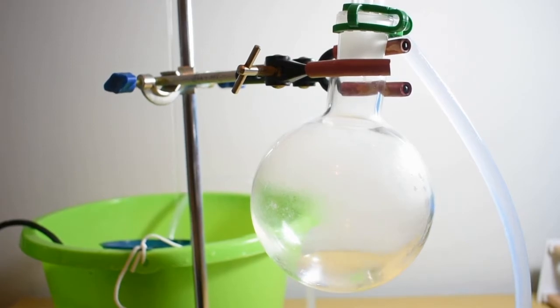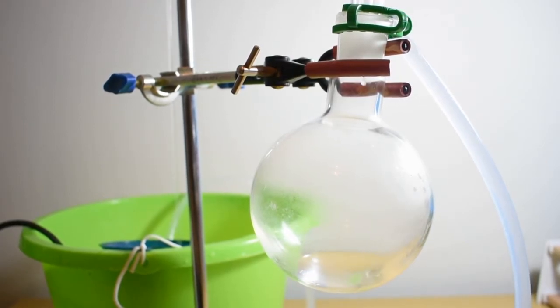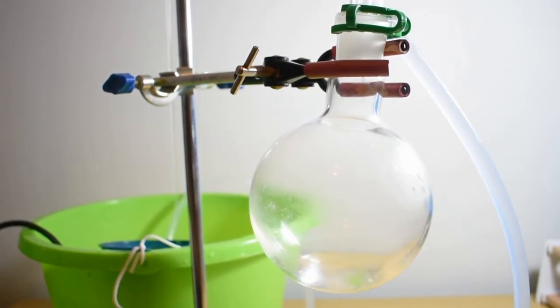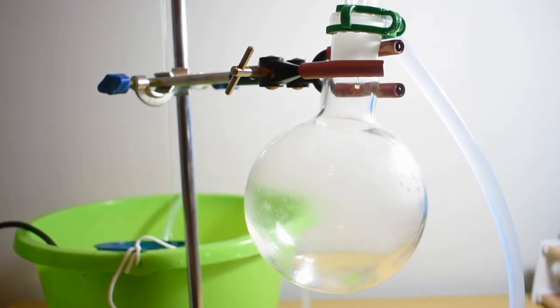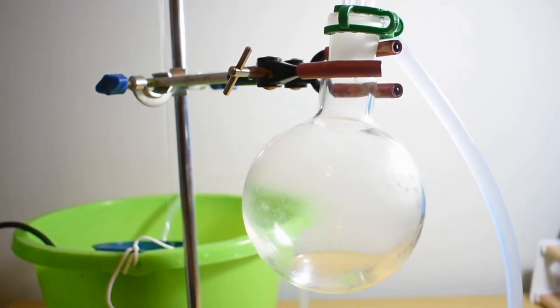There is beginning to be a distillate collecting at quite a steady rate and so once two-thirds of the original solution has been carried over I will stop the distillation and we'll move on to process the ethyl acetate to make it more pure.